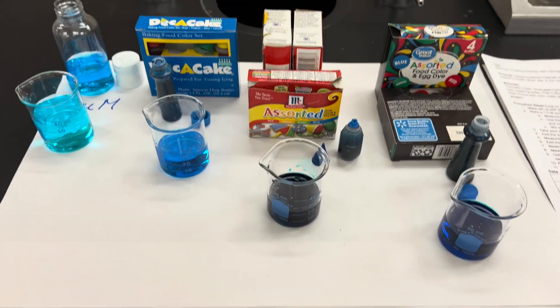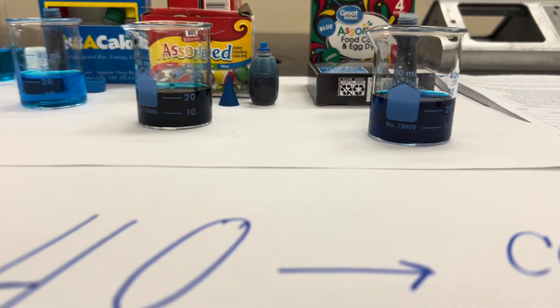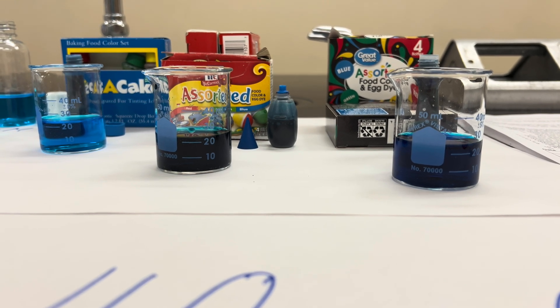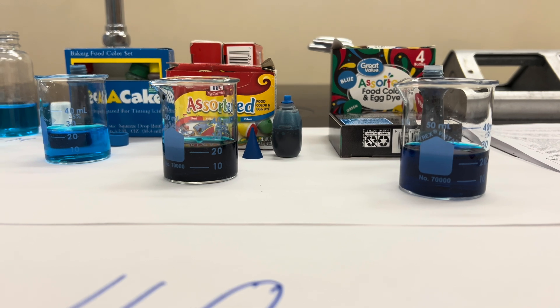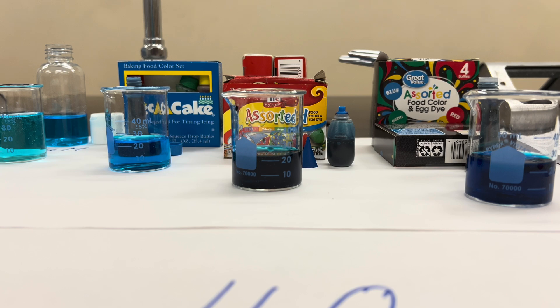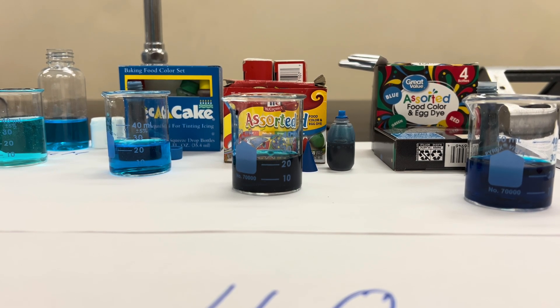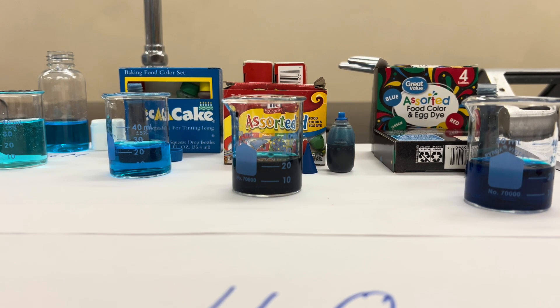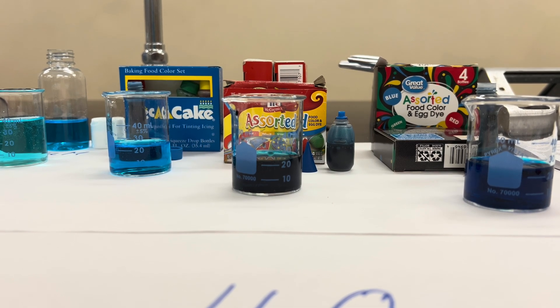As you watch this occur, I set my phone down. My students started to realize that the blue dye was fading, but other things were happening too. I'm going to zoom in on the ingredients of each one so you can check that before doing this experiment — otherwise you're going to have a lot more to talk about.